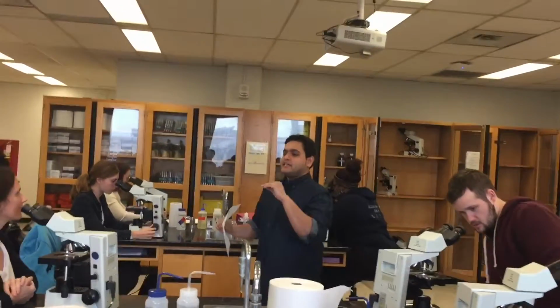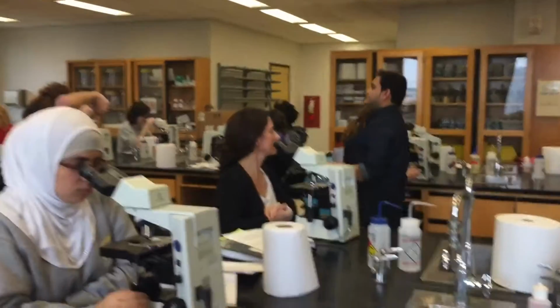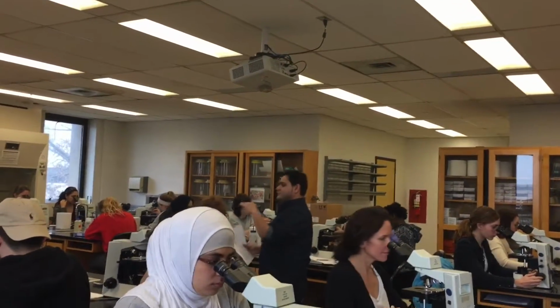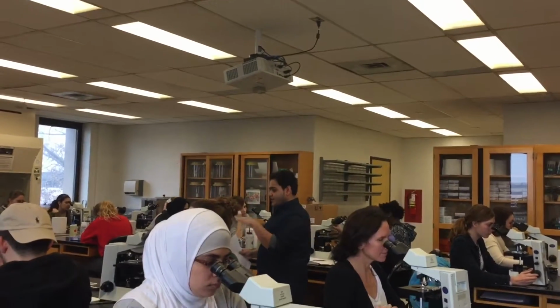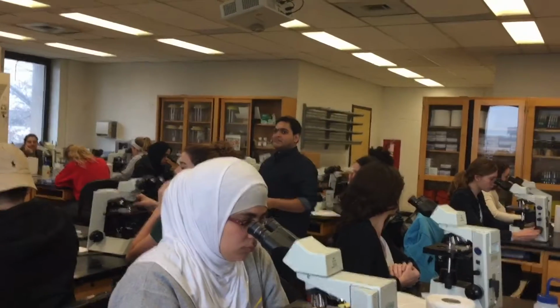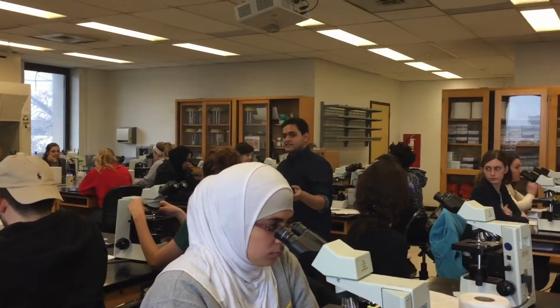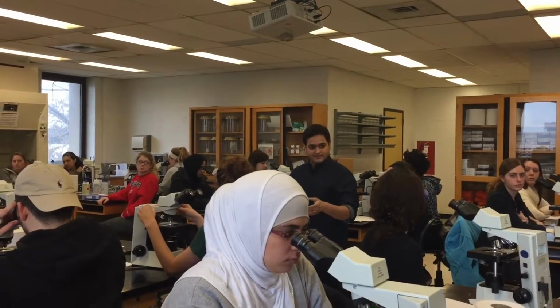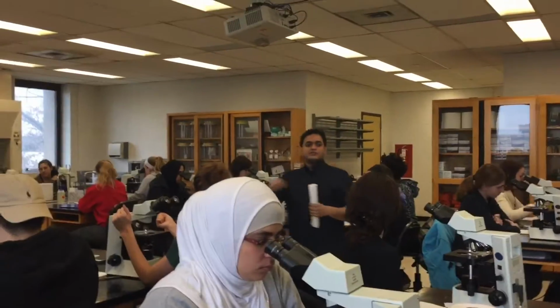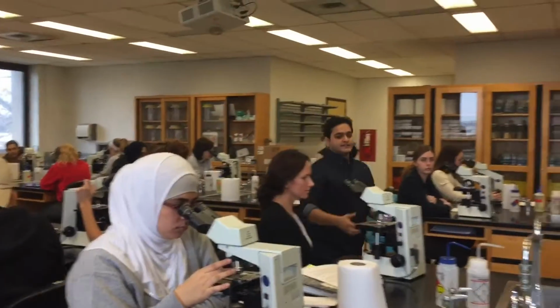Okay. So the next thing we're doing is moving to a high magnification. The best thing that we are going to see is at 100x magnification. The smaller magnifications like 10x and 4x are used just to find a spot where you can look. Basically, if you want to find the CSU classroom, first we are finding where Cleveland is. That's what you're doing with the lower magnification. Once you find the spot, we move to a higher magnification. So if you have already found it at 10x, then you have a look.